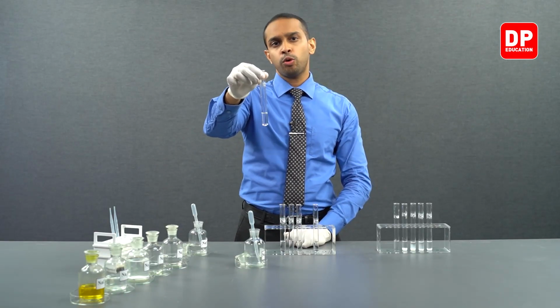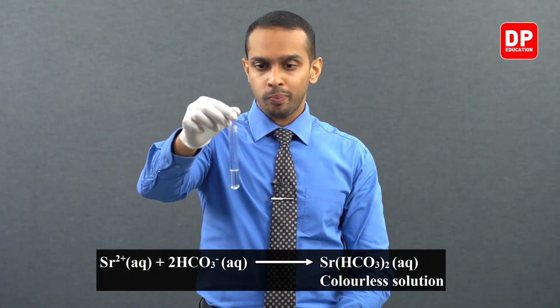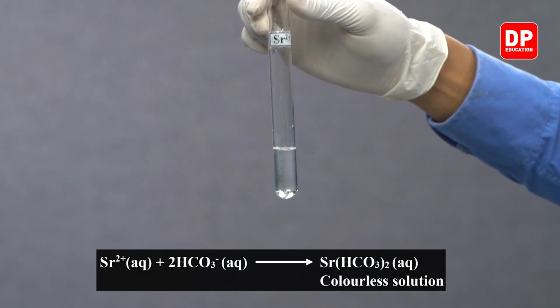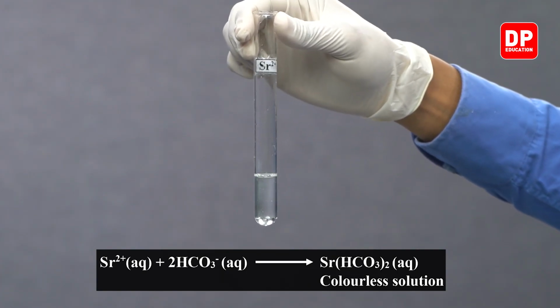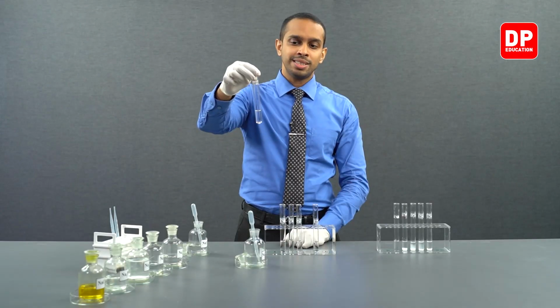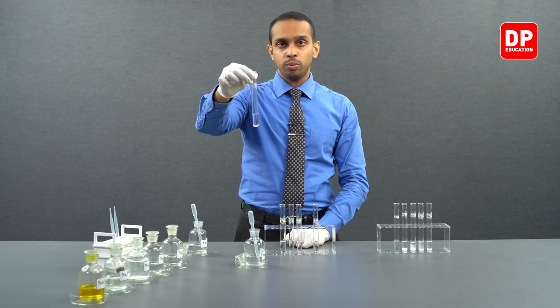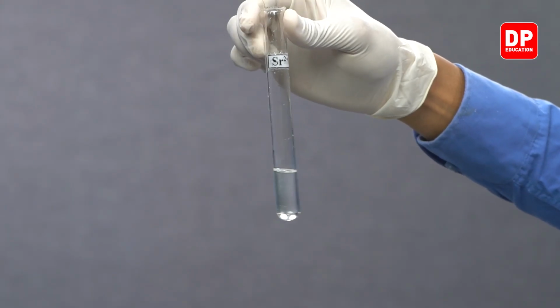Do you observe the formation of a precipitate? The answer would be no. Strontium 2 plus aqueous ions, when they come into contact with bicarbonate anions, will form strontium bicarbonate, which is a water soluble salt. So therefore, you will not see the formation of a precipitate.